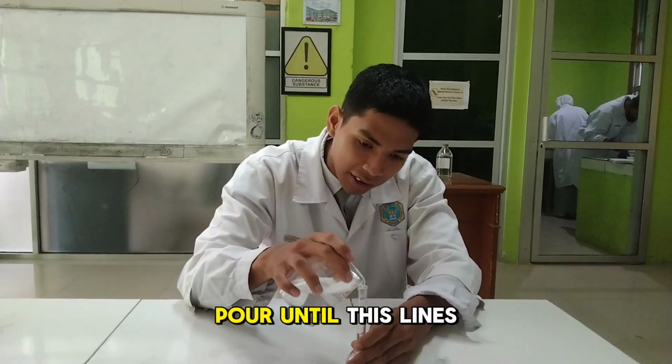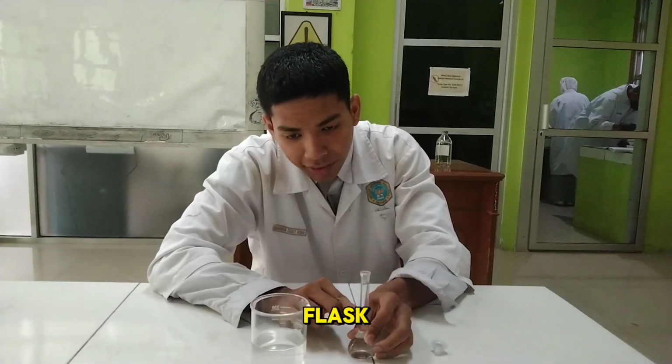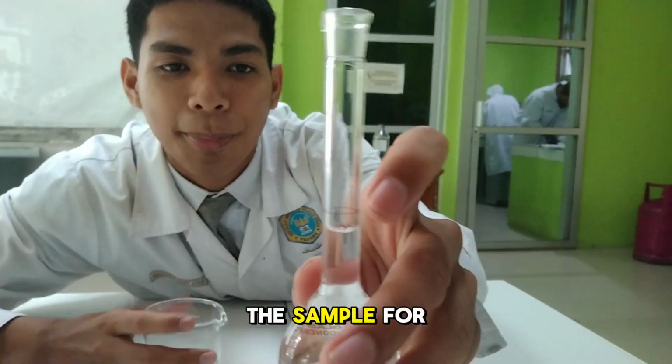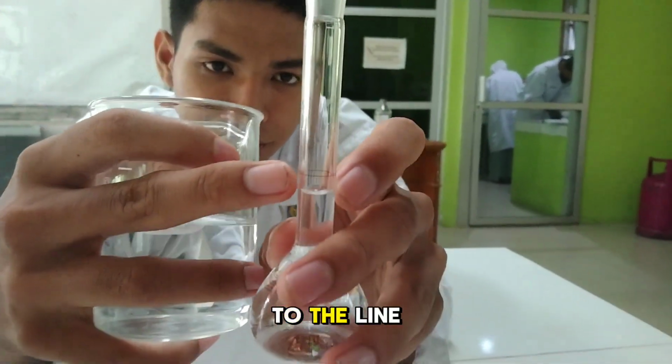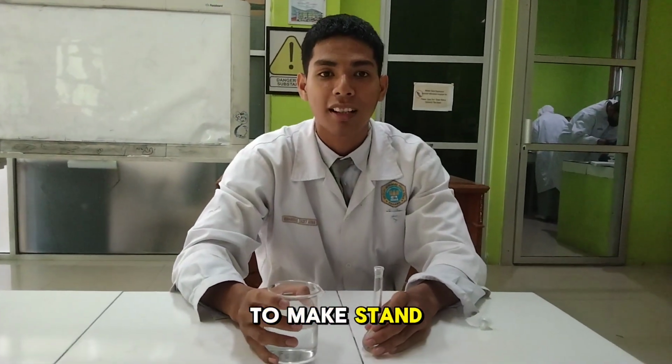We pour until this line of the volumetric flask. You can see we pour the solution to this line. So that's how to make standards.